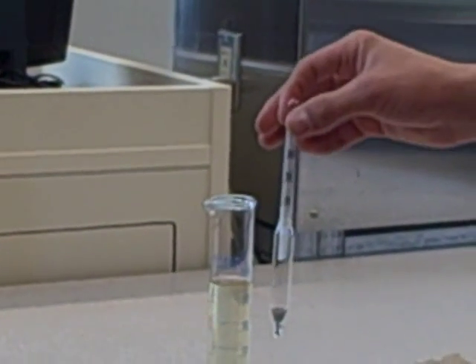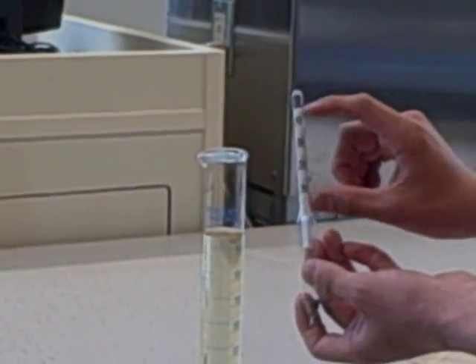You want it to float so that it lands on these measurements right here when you put it in.